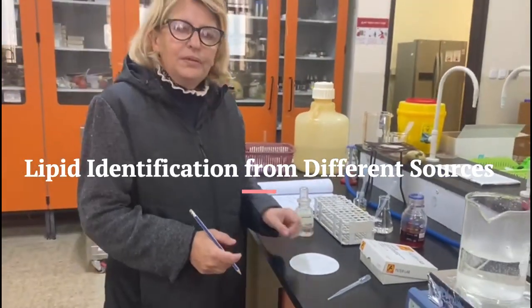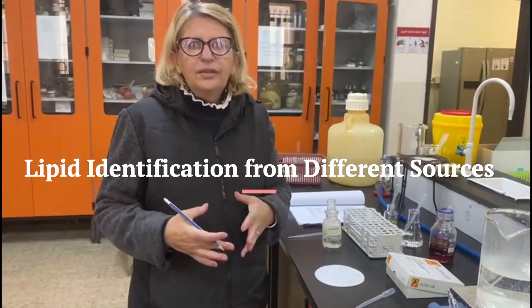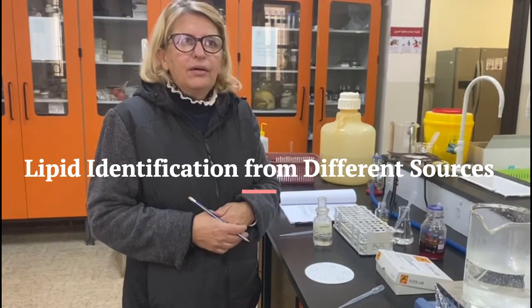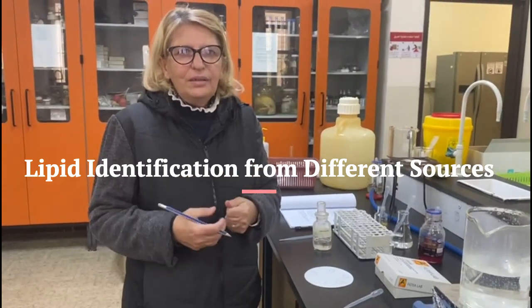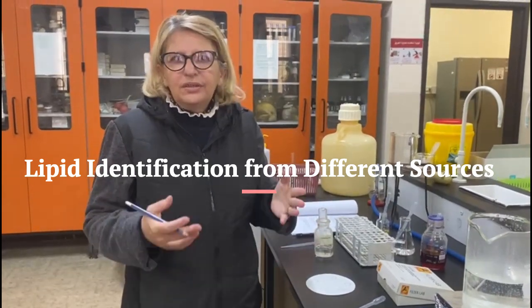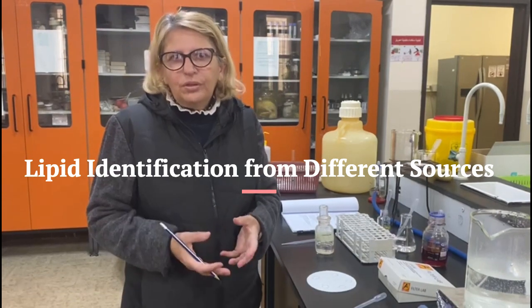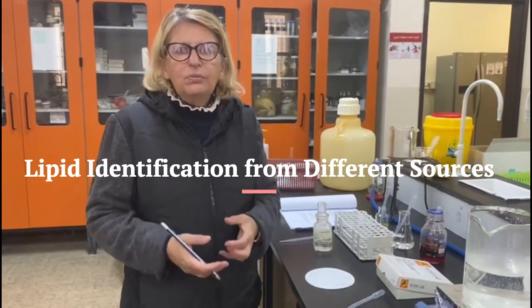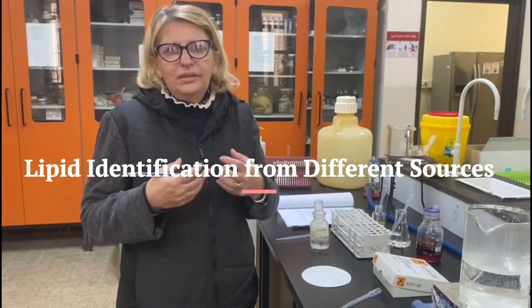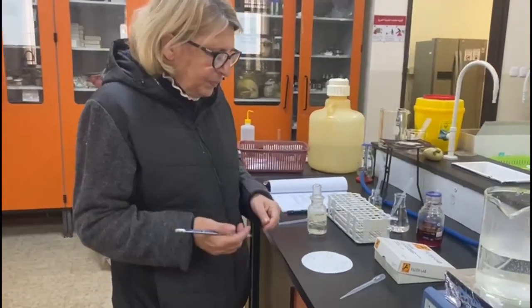The next experiment tries to give an indication of lipid content in different sources of lipids. Now, when we want to extract lipids from a food source, for instance, like nuts, butter, or milk, you cannot extract it using water because lipids are water insoluble, and so we use ether, which is a solvent that is hydrophobic, in order to extract these substances.